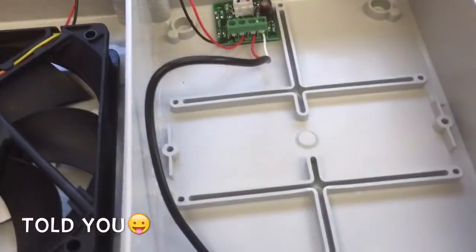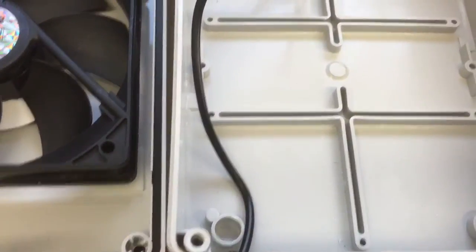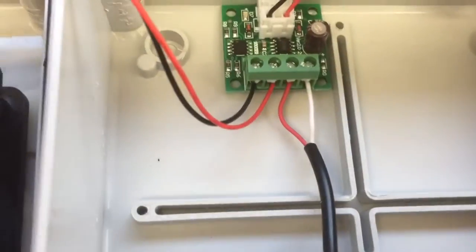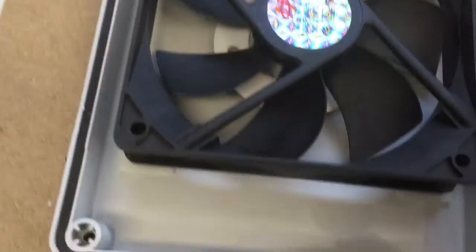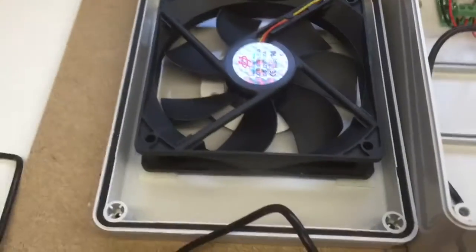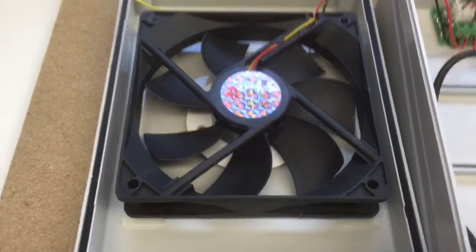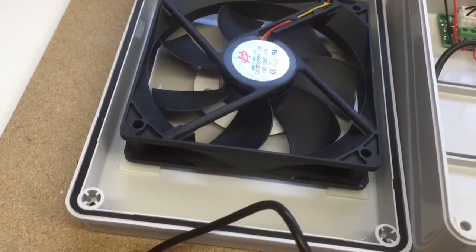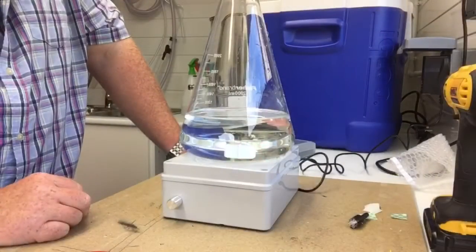Okay, right. It's more or less set. So I didn't need to show you this, but you couldn't really see it anyway. But supply in, out. I know it doesn't look like it's right, but I assure you it certainly is. I had to mess about with the magnets a couple of times just to get it right. Well, what I think was right. And so yeah, I think we're more or less there. It's all working. Well, I think it's working. I haven't tried it yet, but properly. Come back to you in a minute.